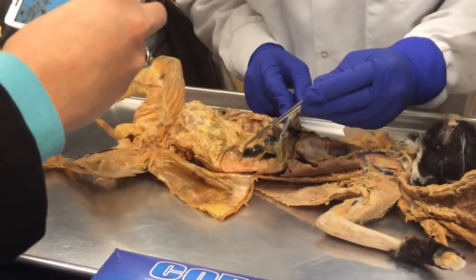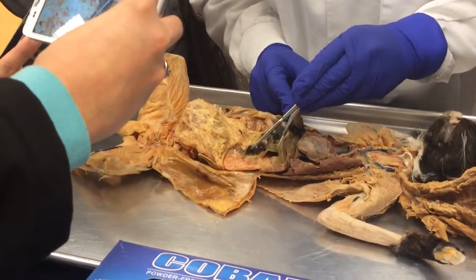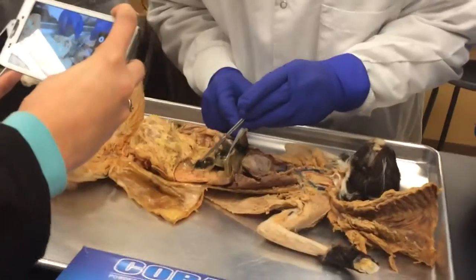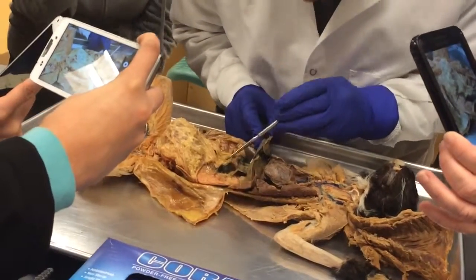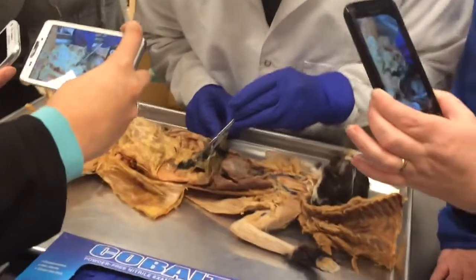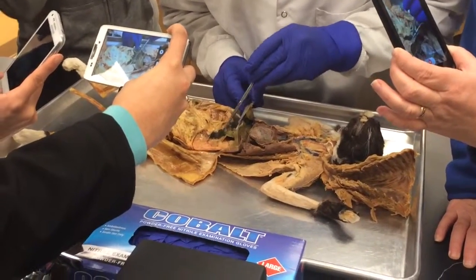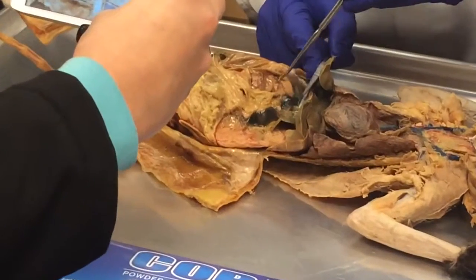Up to here, and then this part here, this sort of tubular part of the stomach heading towards the pyloric sphincter, that's the pyloric region, or pylorus, if you like. And the pyloric sphincter, you can actually see the indentation of it right here. Actually, it's here. So this is that sort of tubular part of the stomach called the pylorus. It's just been tinted a little bit by the gallbladder, but it's not the natural color. And then the pyloric sphincter over here. And then this is the duodenum.